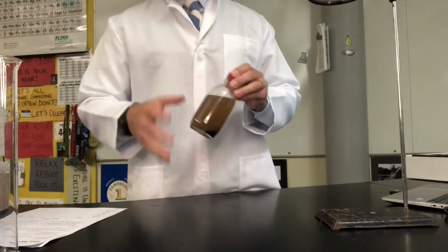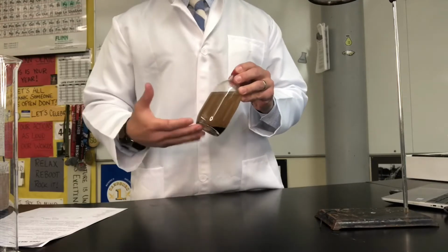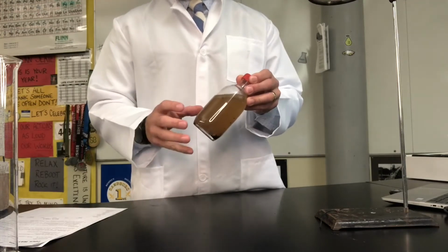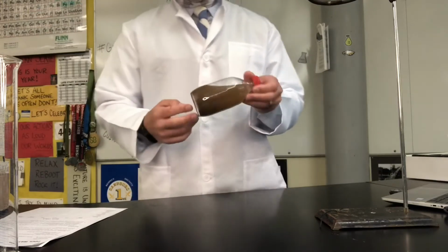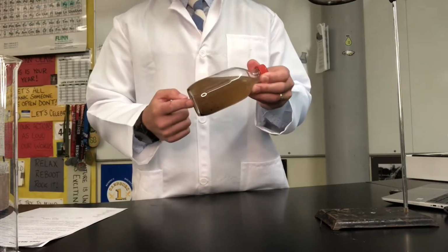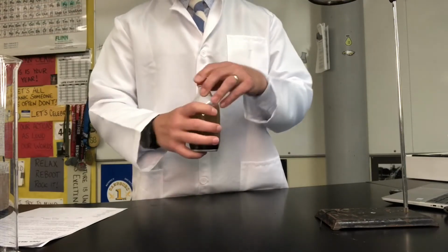Now, we're going to take some observations, mention its physical properties, and we're going to slowly try to clean this water through something we call physical separations. So to do that, the first thing we need to do is kind of get our pulse on this liquid and see what it's like. If you look at your lab, we're going to be collecting data on its color, its clarity, its odor or its smell, if we see any oil in it, and also if there's any solids. So some of these will be a yes/no answer, but we'll go through that.